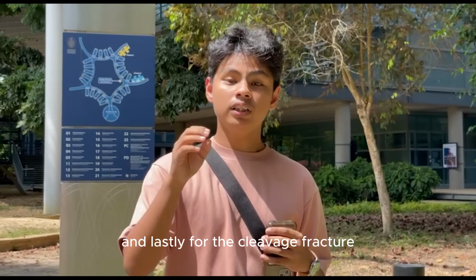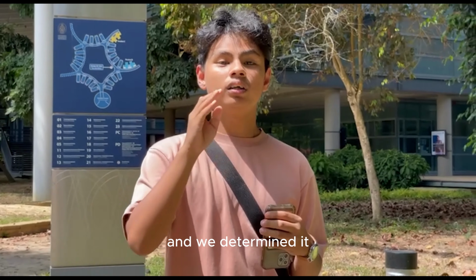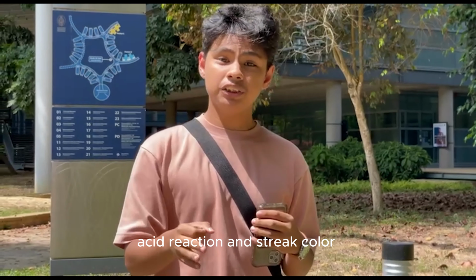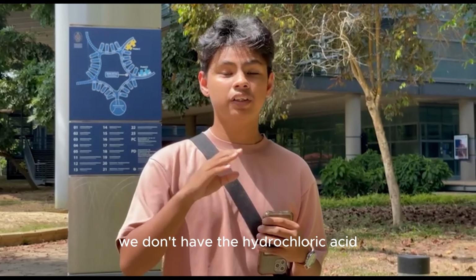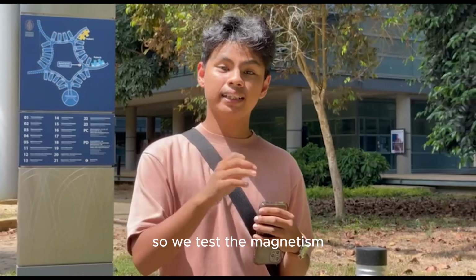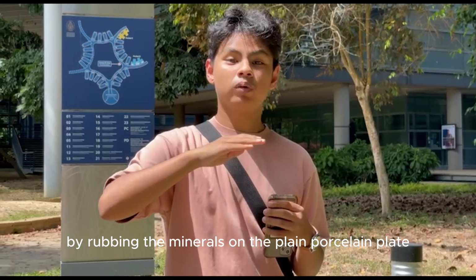And lastly, for the cleavage and fracture, we see how the mineral breaks and then we determine which axis it breaks on. And then for the chemical properties, we have magnetism, acid reaction and streak color. But unfortunately for this experiment, we don't have the hydrochloric acid to react with the mineral. So we test the magnetism and also the streak by rubbing the minerals on the plain porcelain plate.